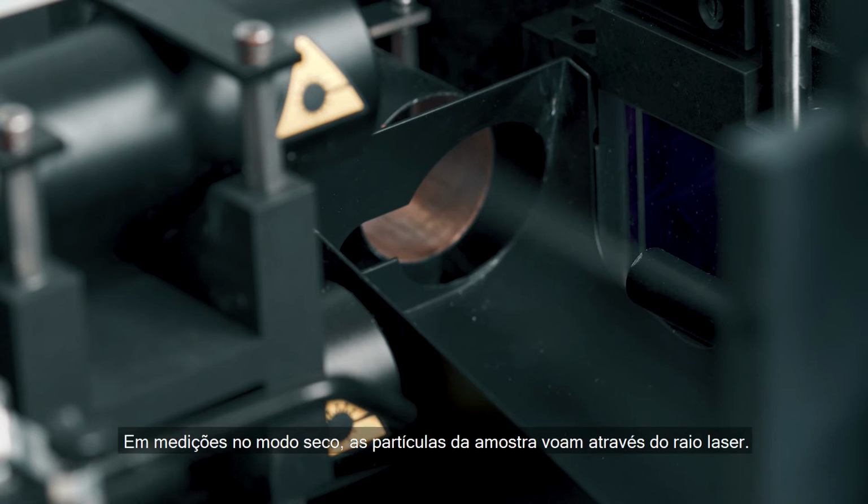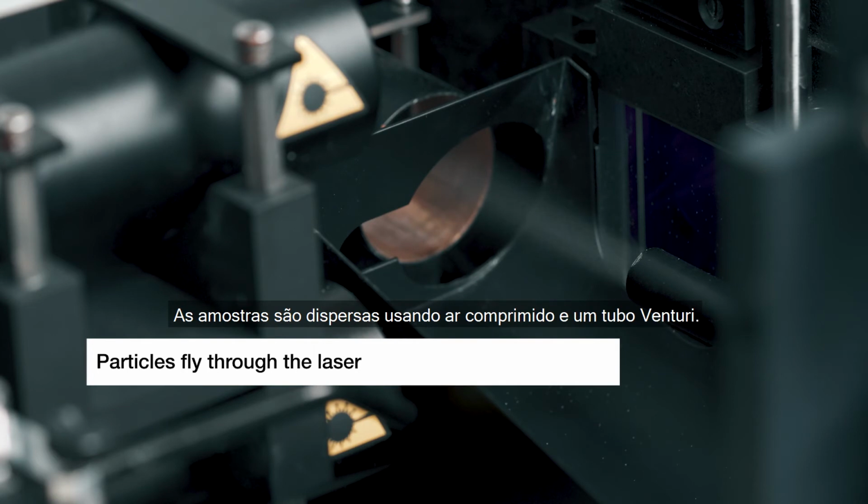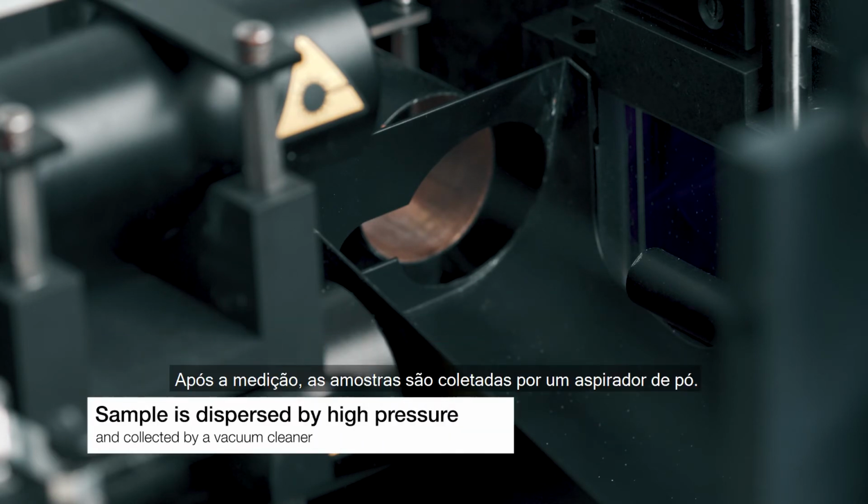In dry measurements, the sample particles fly through the laser beam. The samples are dispersed using compressed air and a Venturi nozzle. After measurement, the samples are collected by a vacuum cleaner.